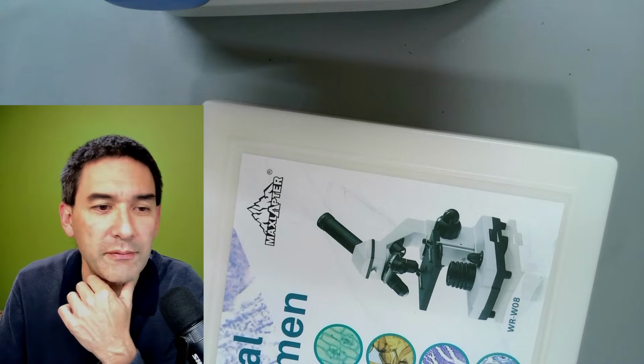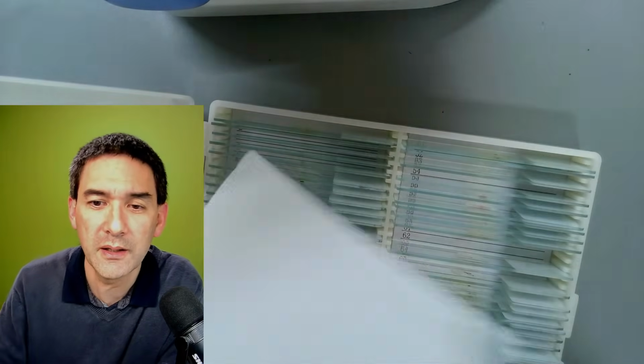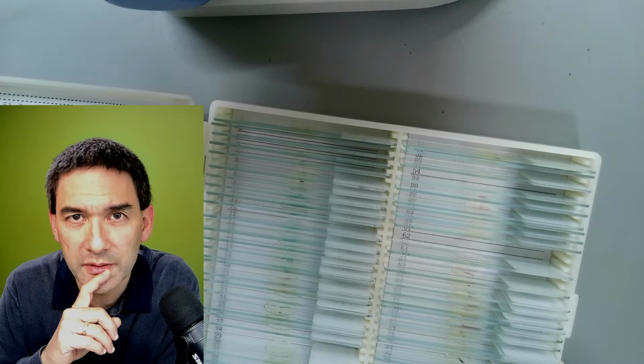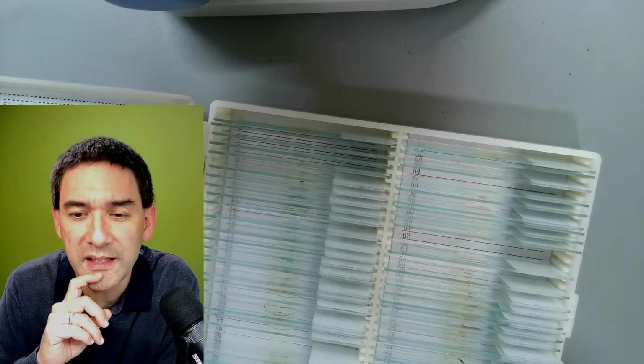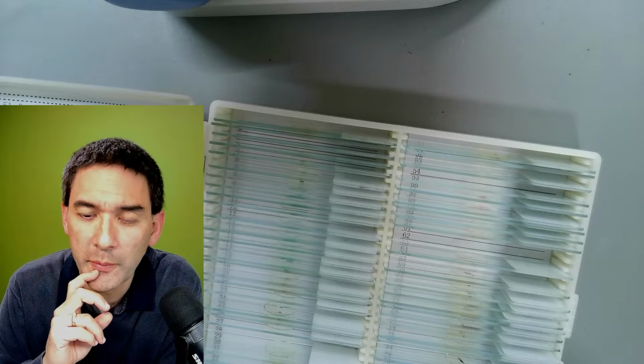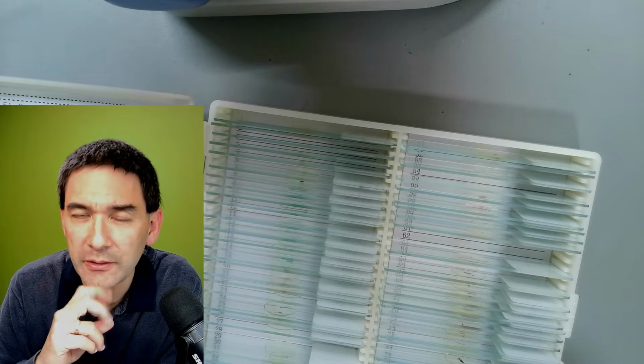So it's been again 1.5 hours. Maybe next week I can show you some of the equipment that I have for connecting a DSLR. Some adapters there. You might have seen some of those already, some you might not have seen yet. So I'm going to give you an overview. As a general recommendation, because I'm getting a lot of comments and emails about connecting cameras, there is probably not one single best way. A little bit of trial and error is involved.